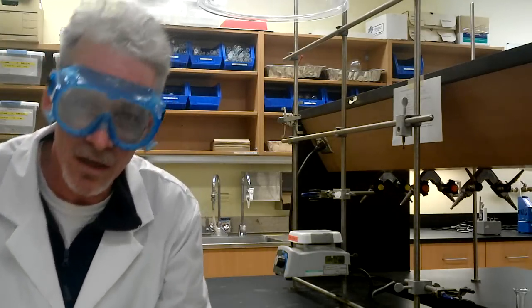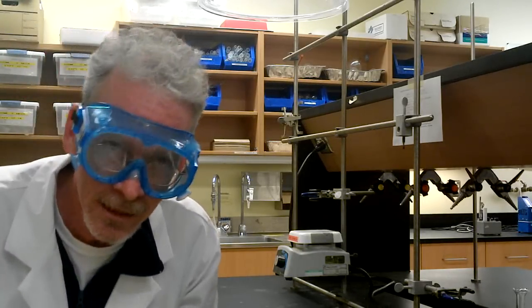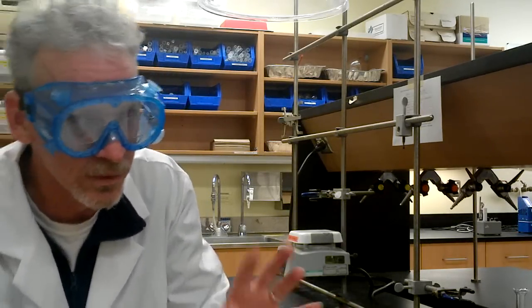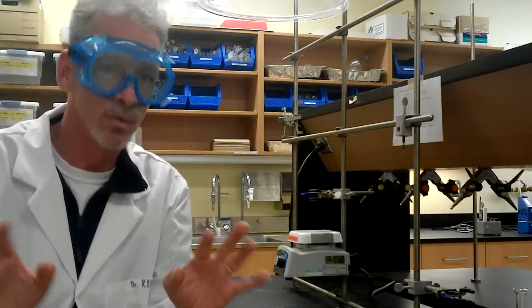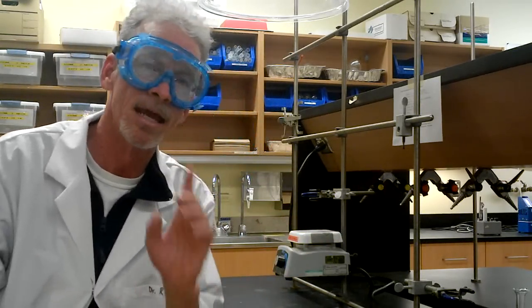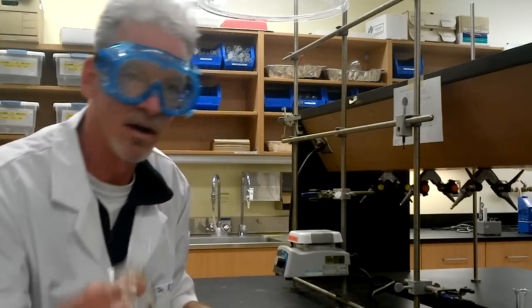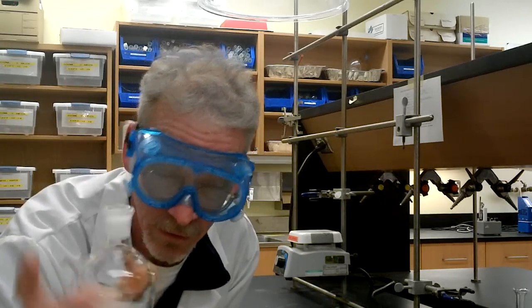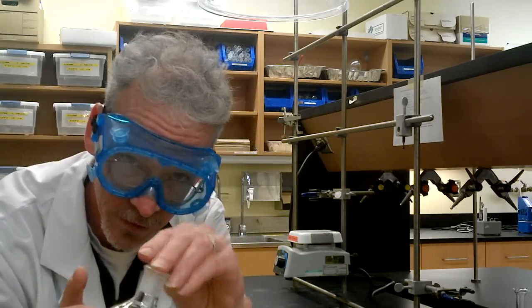So our experiment is fairly straightforward and a little bit hazardous. You're dealing with concentrated acids, so we've got to be careful. We have glassware that we need to set up, and the first thing we need is our 100 milliliter round bottom flask with a stir bar.